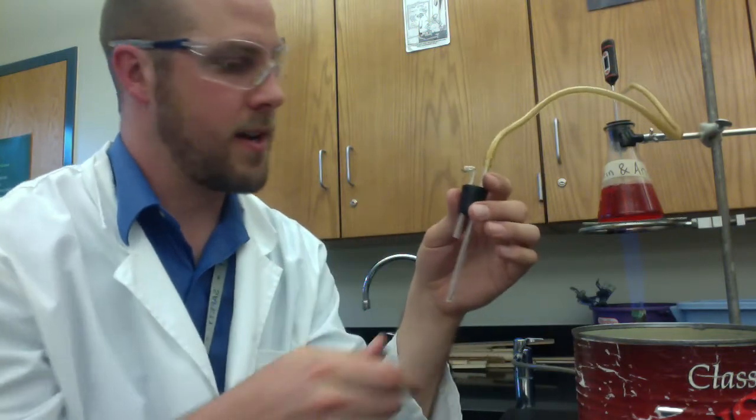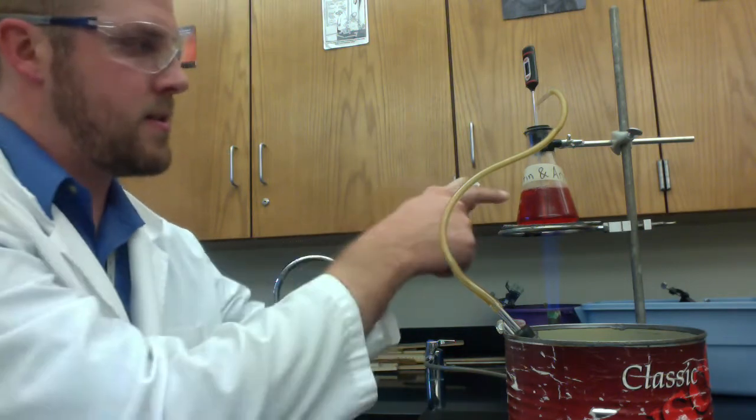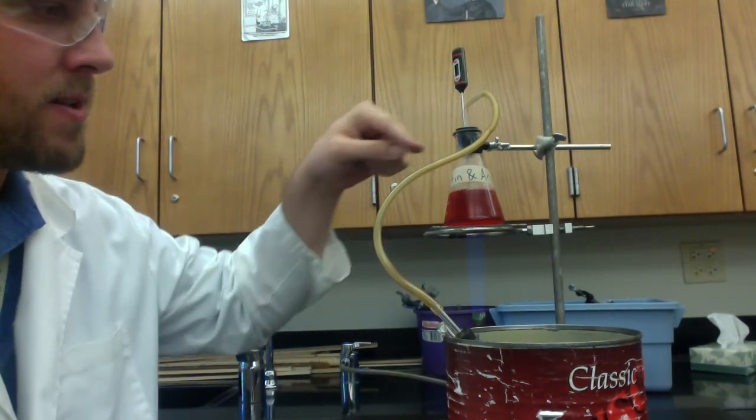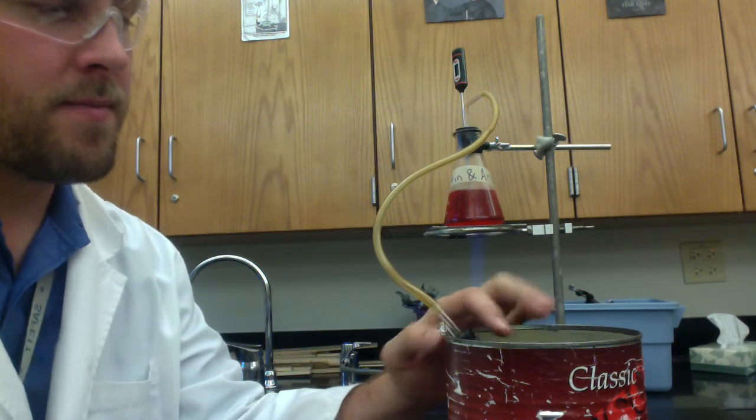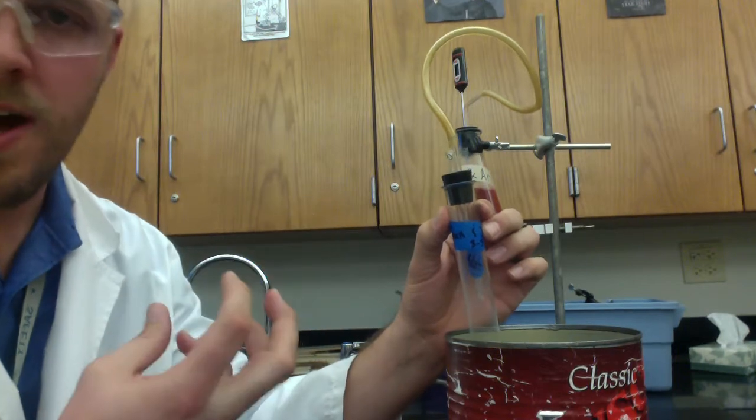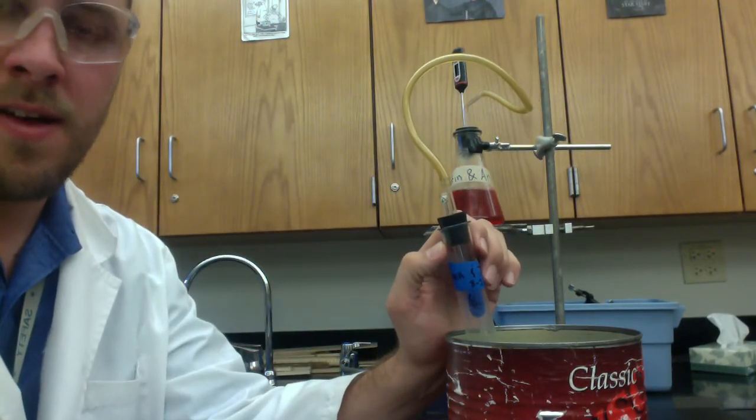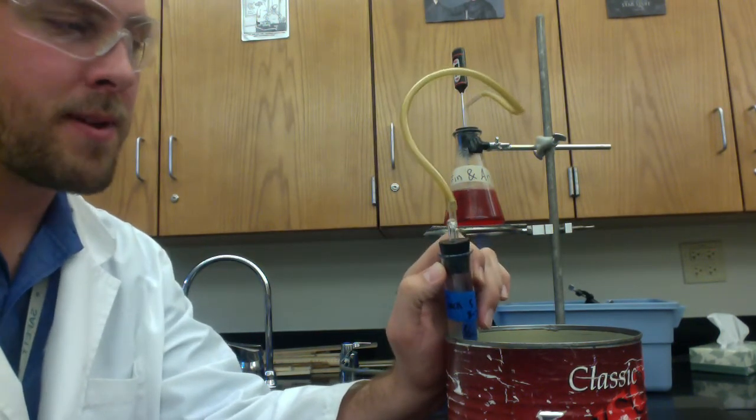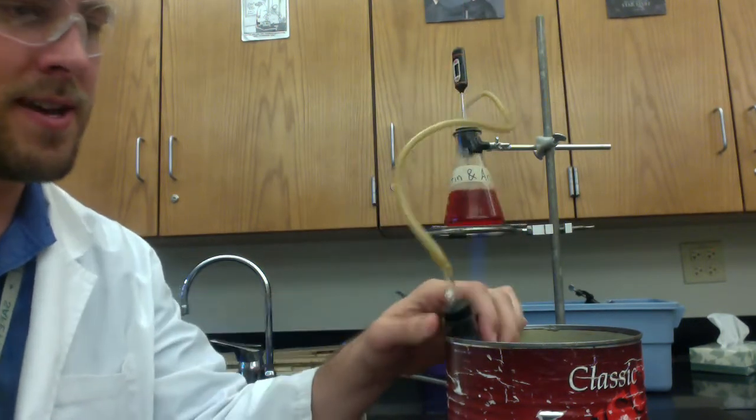So after you write down the temperature that you saw the carbon dioxide boiling at, now you're going to transfer it to your test tube. And ideally your test tube has a nice little L-hook kind of thing on this side so you can kind of hang it off the side of your reaction like that. You want to make sure as much of that test tube is submerged as possible and kind of at all times because what's going to start happening here is the water vapor, you'll notice, you can maybe see it's starting to boil from this soda. It's traveling down this tubing here and into the test tube. And our goal, what we're going to have happen is we want when that vapor, the steam, hits this area, we want it to kind of get shocked by how cold it is back into the experience of phase change, condensation, remember we talked about that last month, back into liquid water and we'll be able to collect that liquid water in this test tube. So you want to keep it submerged here and you want to keep a good amount of ice in there. Remember that ice will start getting used up.